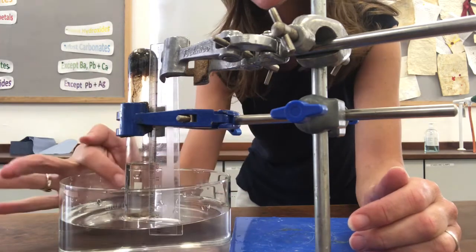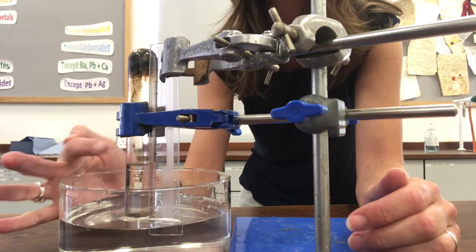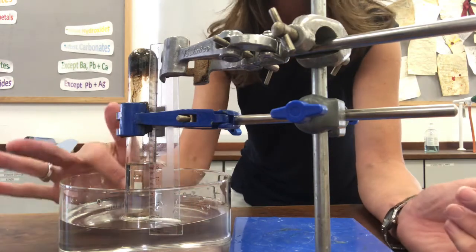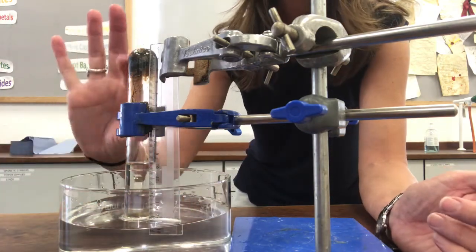I hope you can also see that the water level has gone up inside that boiling tube, which is exactly what we expected. The water level's gone up, the length of the bubble has decreased.